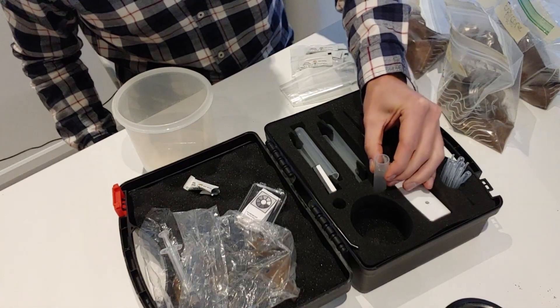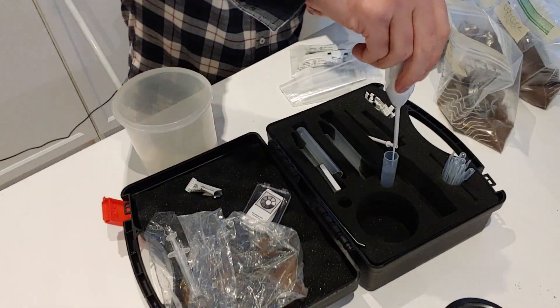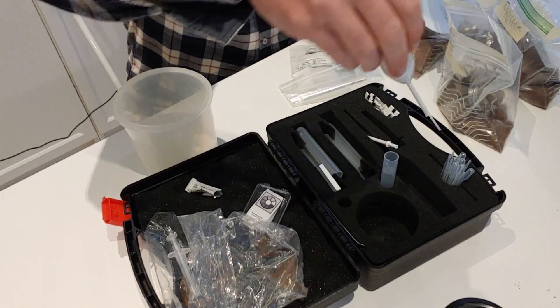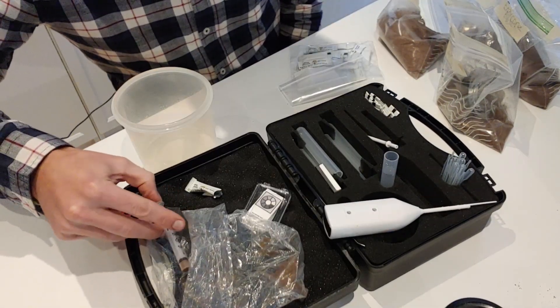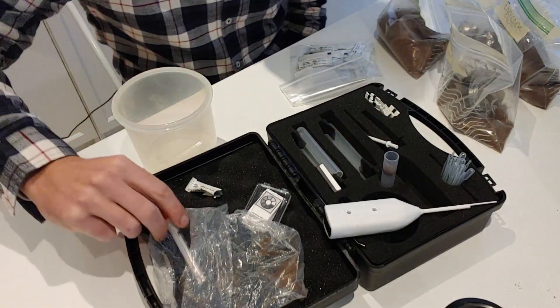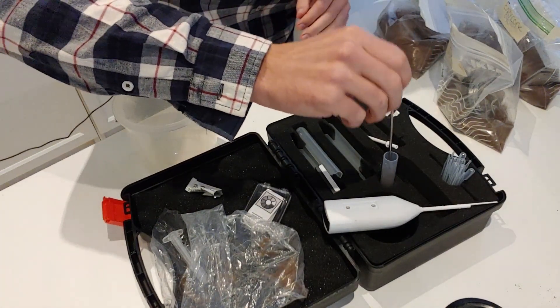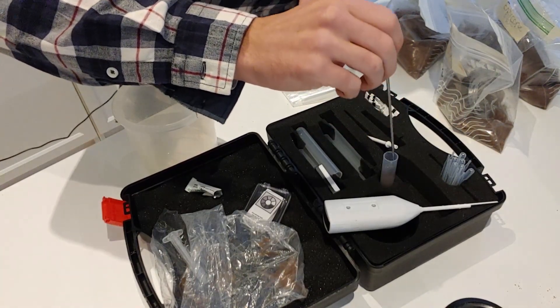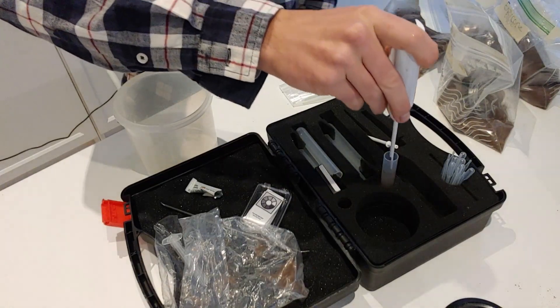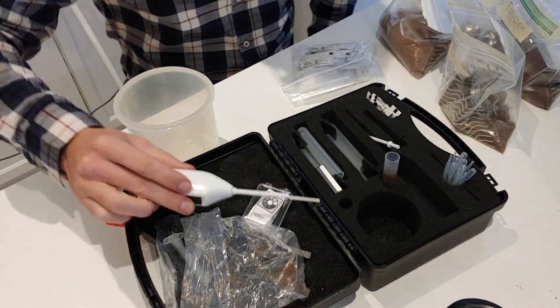This little stand makes it nice and convenient so that things don't slip. Here is the whisking device — you only need to mix it for just a couple of seconds. That should be enough. From here, I'm going to add my half-milliliter soil sample directly into the solution and use the little probe to break it up so that it isn't compacted. Then we whisk again for 30 seconds.